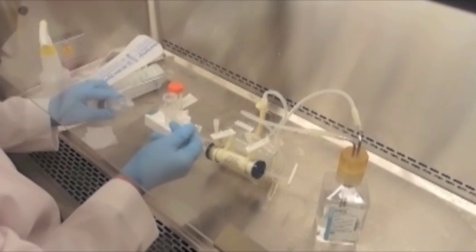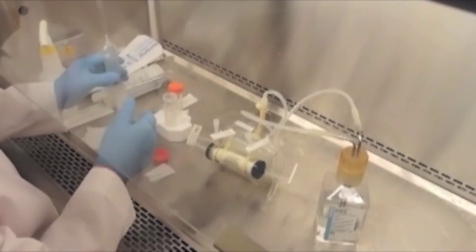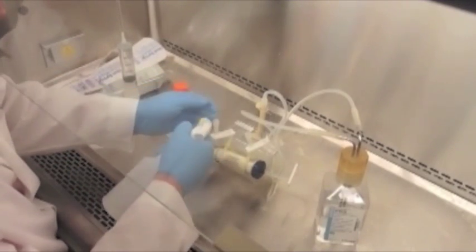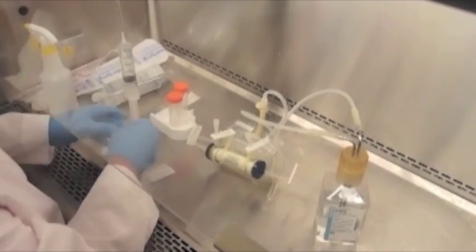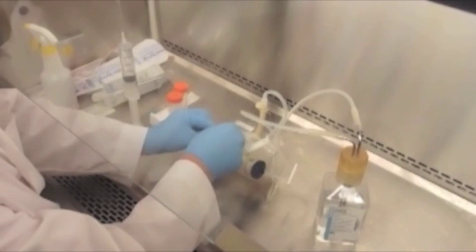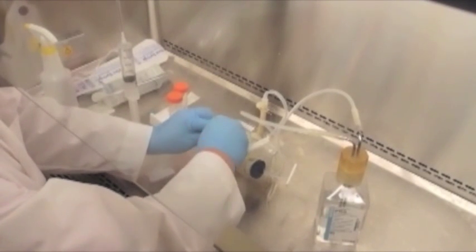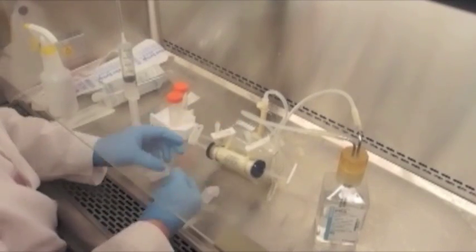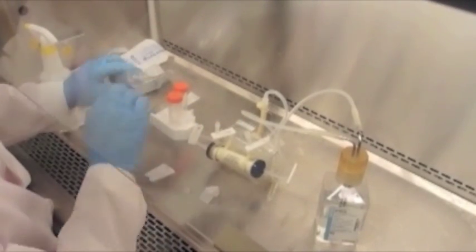Now since it's a blunt needle, we can safely cover it up. This is how we can remove the needle. We're going to spray the luer fittings down with a copious amount of 70% ethanol. In some areas, and in the summertime, you can find also yeast and fungi and other types of spores.